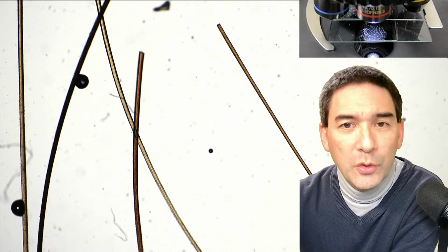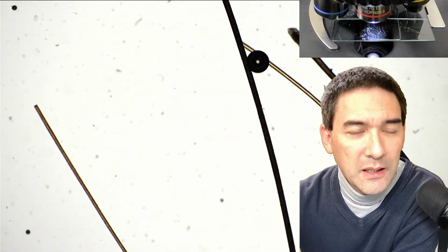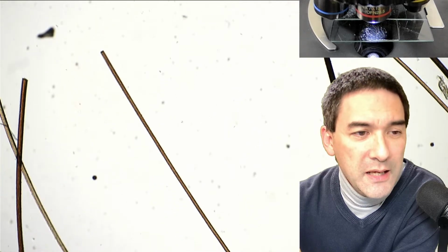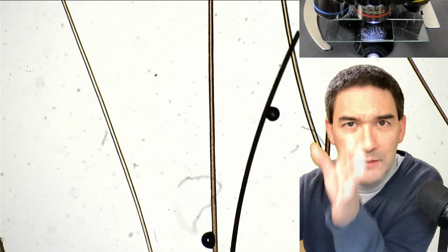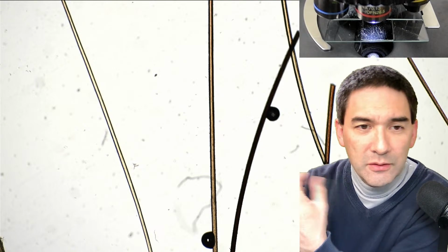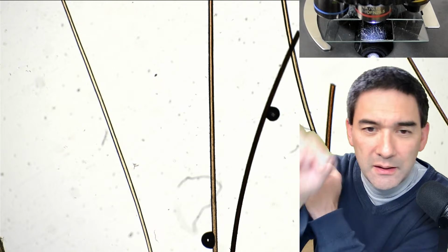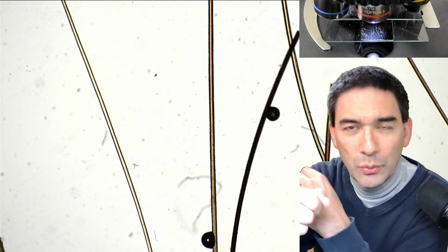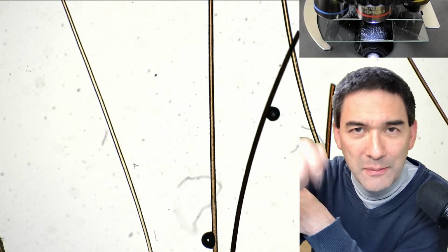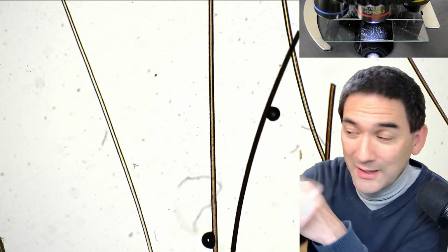So we want to go up a little bit with the magnification as well. You see a few air bubbles. I've used the PVA glue, and what I have done here is I arranged them, or I tried to get them as parallel as possible. I cut off a little piece of hair and I dipped it in the glue and glued it first on one side. Only after the glue has dried did I apply the rest of the mounting medium, the rest of the glue, and then put a cover glass on top.